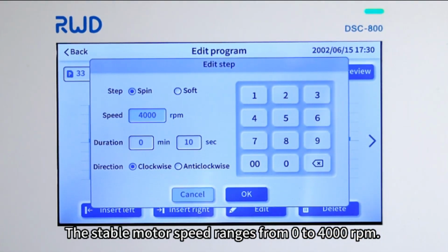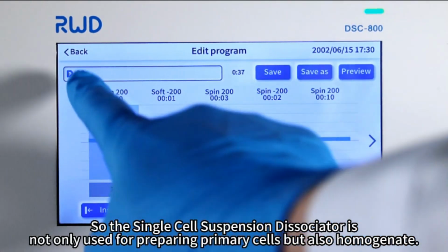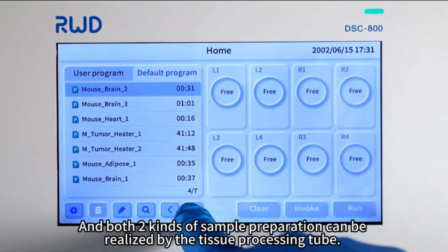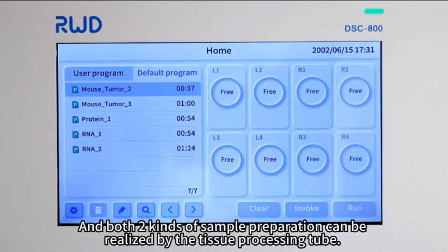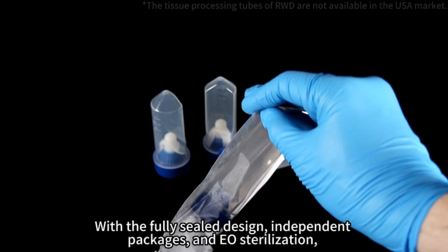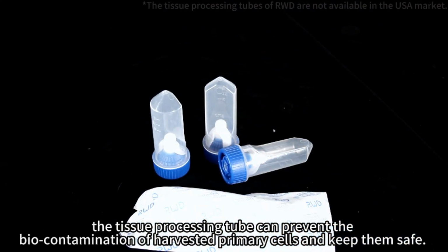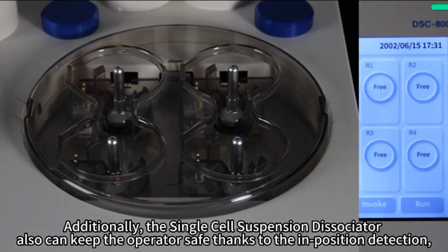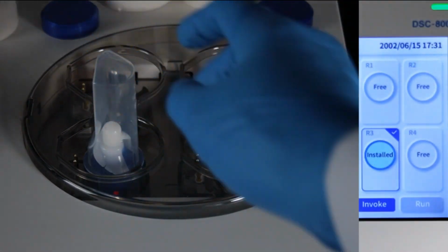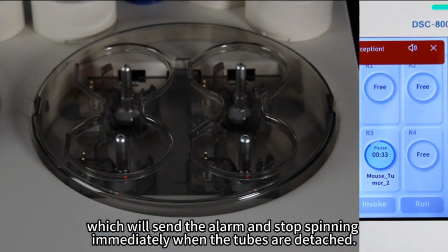So the single cell suspension dissociator is not only used for preparing primary cells but also homogenate. And both two kinds of sample preparation can be realized by the tissue processing tube. With the fully sealed design, independent packages, and EO sterilization, the tissue processing tube can prevent the biocontamination of harvested primary cells and keep them safe. Additionally, the single cell suspension dissociator also can keep the operator safe thanks to the in-position detection, which will send the alarm and stop spinning immediately when the tubes are detached.